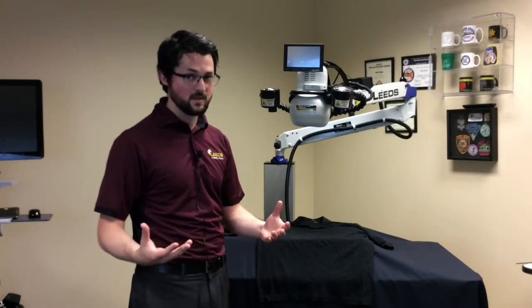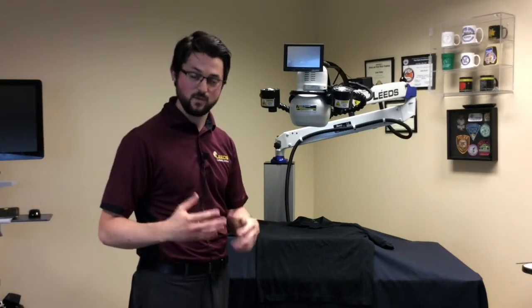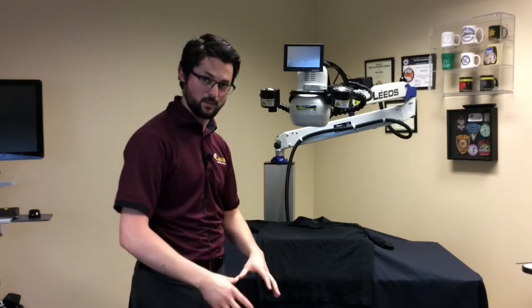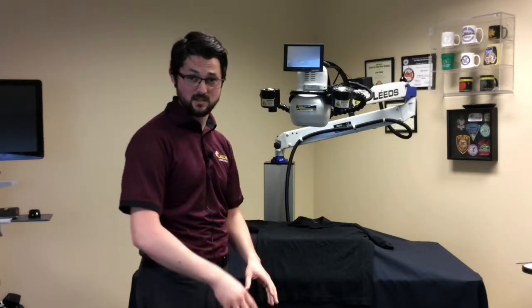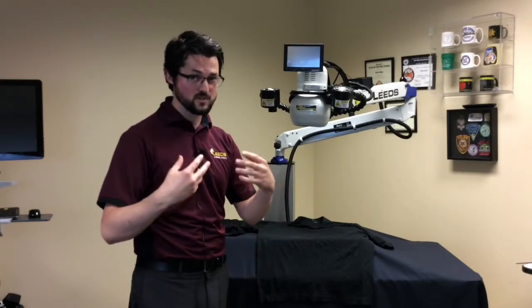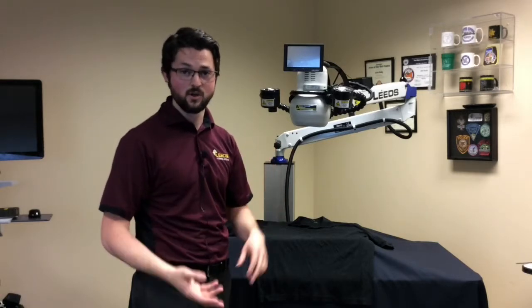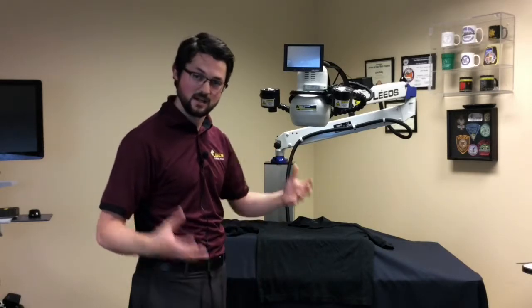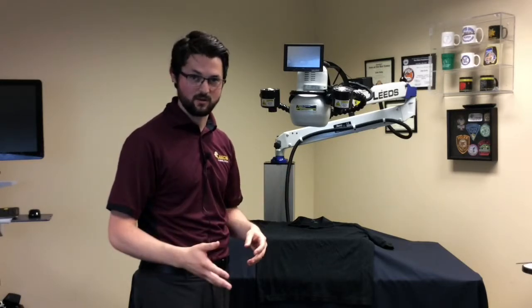So what ends up happening is now I have a difference that I can take advantage of with filters. In summary: blue light hits the sample, the shirt reflects back the blue light, and the semen stains emit orange light. By placing an orange filter — either as goggles or using a spectral imaging system such as the LSV — I can now see that contrast difference between the semen stains and their background.